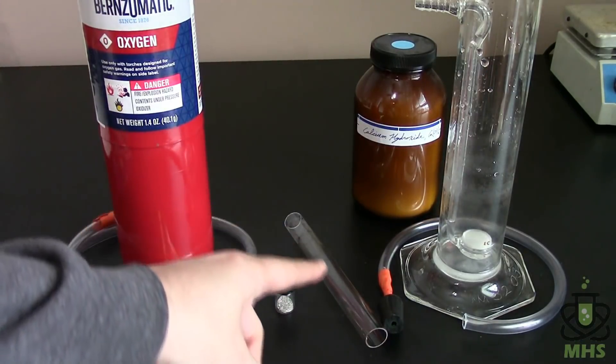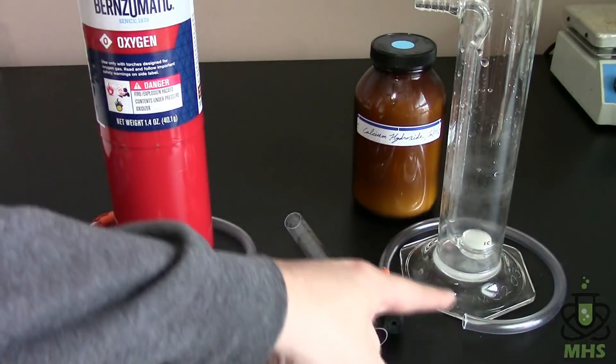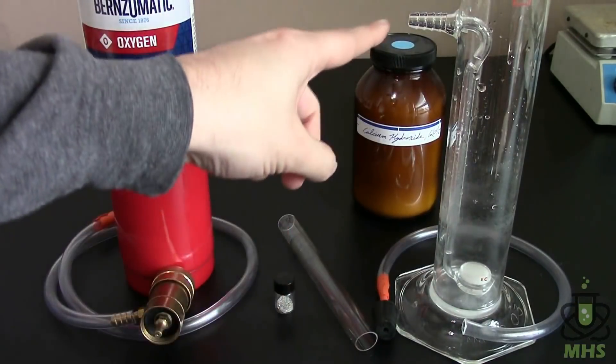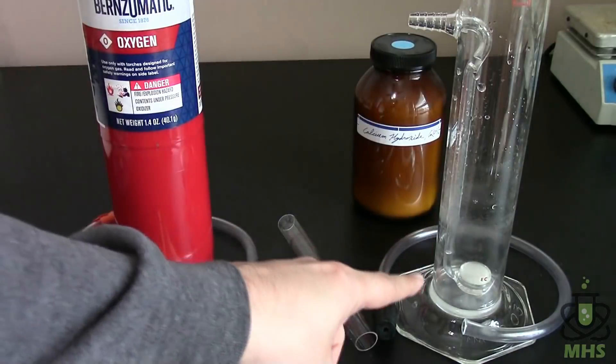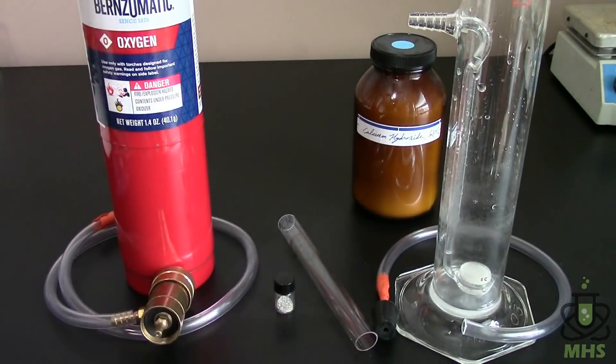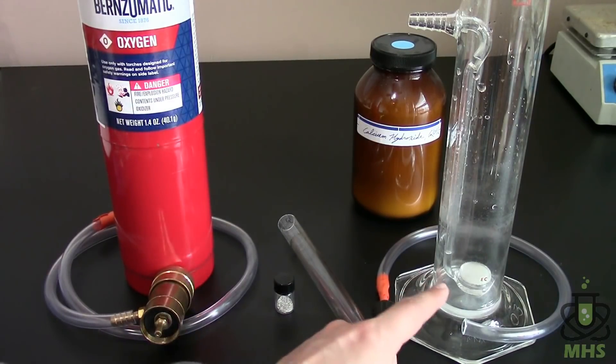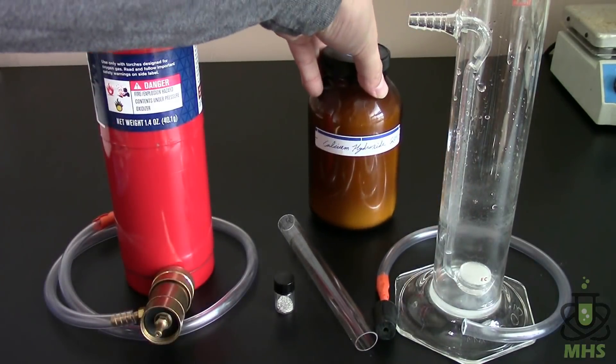And then the final part of this after the oxygen passes through this tube it's going to enter in this vinyl tubing and go into the gas wash bottle here. What happens is the tubing comes into the inlet port here and it goes down that inner glass tube and it passes through that white disc which is a frit. It's a fine mesh of glass fibers and that splits up the bubbles a lot.